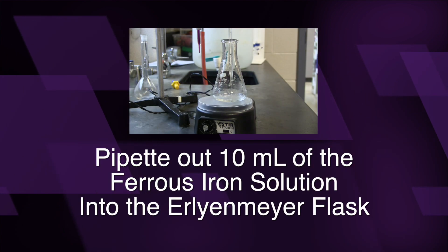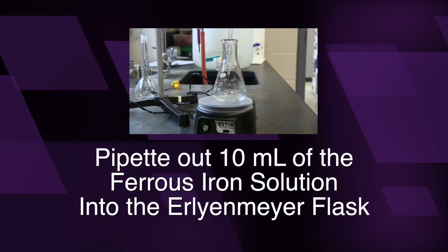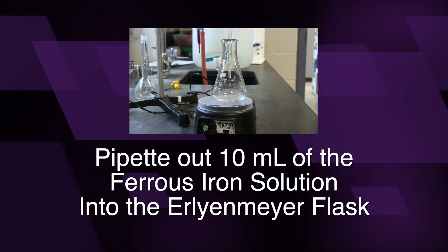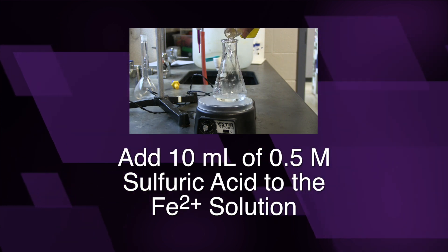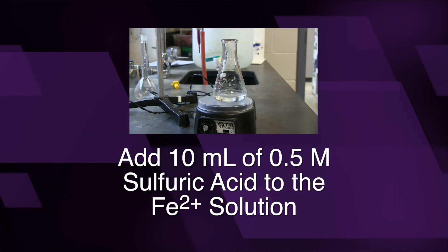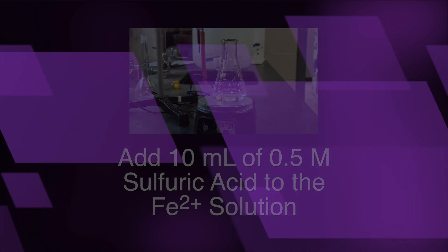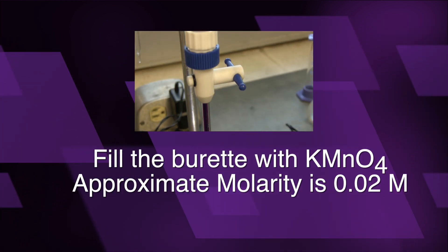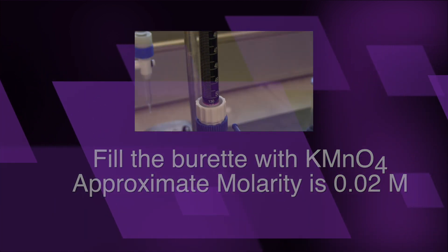Pipette out 10 ml of the ferrous ion solution into an Erlenmeyer flask. Add 10 ml of 0.5 molar sulfuric acid to this solution. Fill the burette with the potassium permanganate solution.